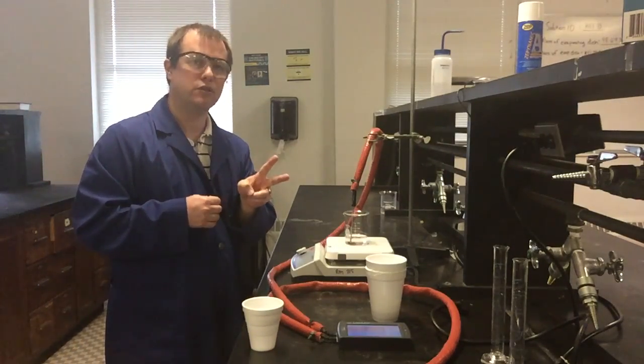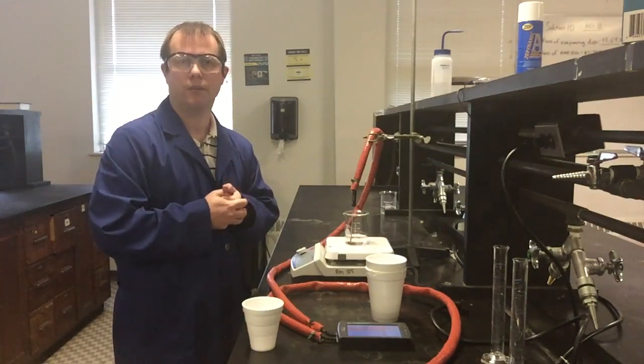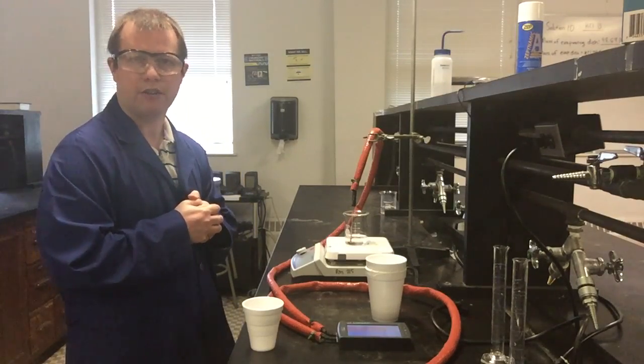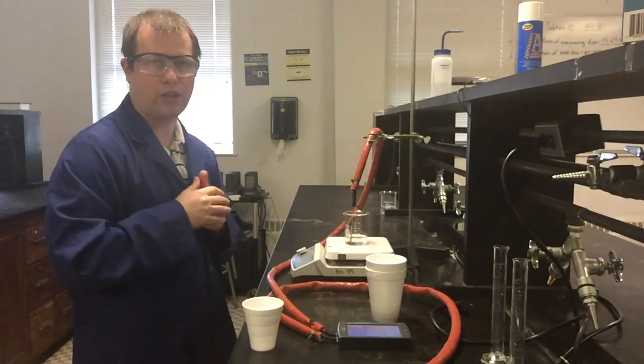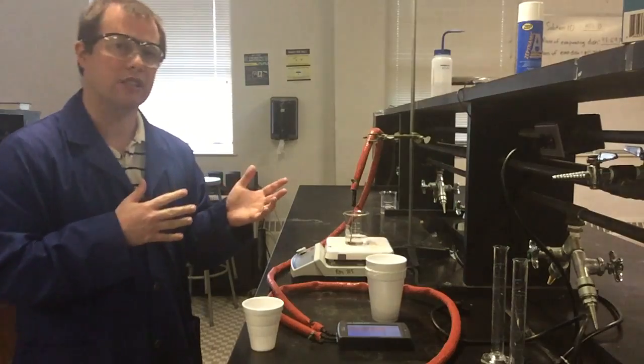Normally you do this experiment 2 times. On video I'm going to show it once. At the end though I'm going to provide data for 2 full trials so that you can look at that and figure out which trial you think looks better to use for your calculations. Again, I'll talk more about that as we get there. But for right now I'm going to cut the video over for just a moment. When I come back we'll see our temperature up over 40 degrees and we'll actually get started with the experiment itself.